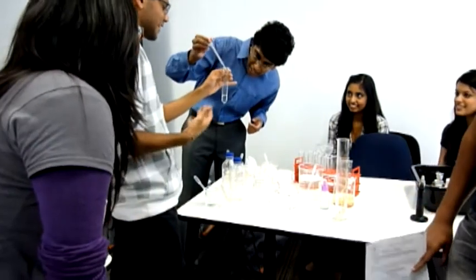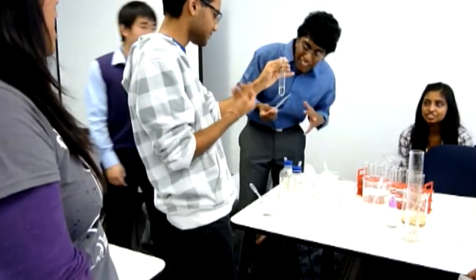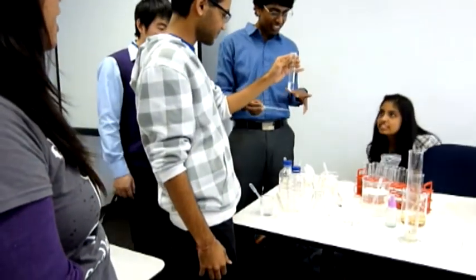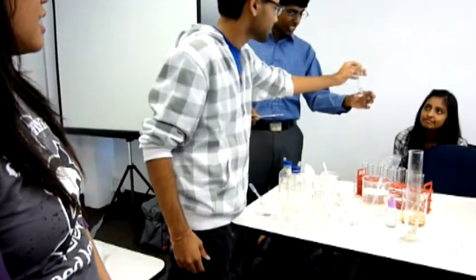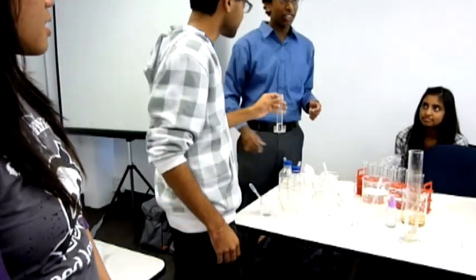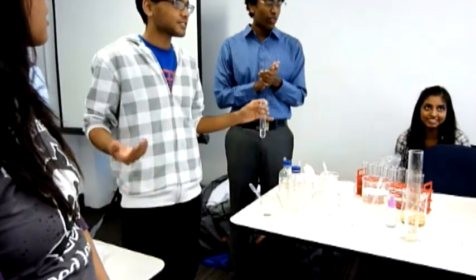There's still a bit going on. Can we see it? Do we all see it? Yeah, just a little. For the benefit of everyone. Do we want to do it again? Who didn't see it? It's all good. Move on.